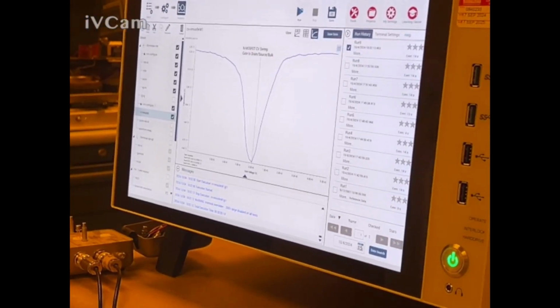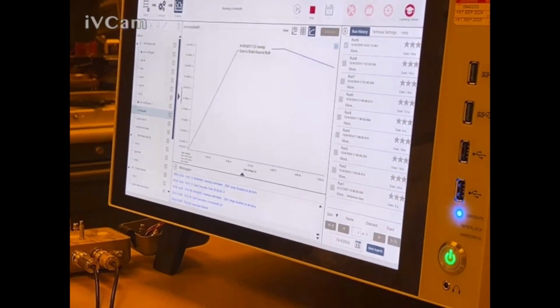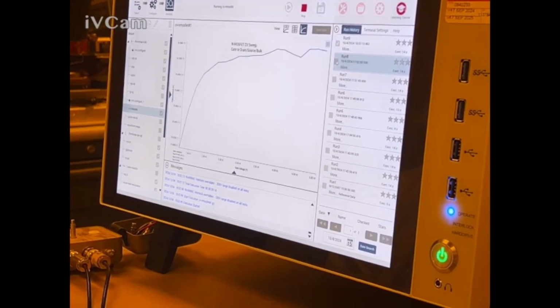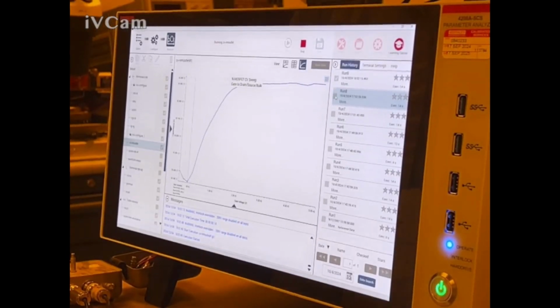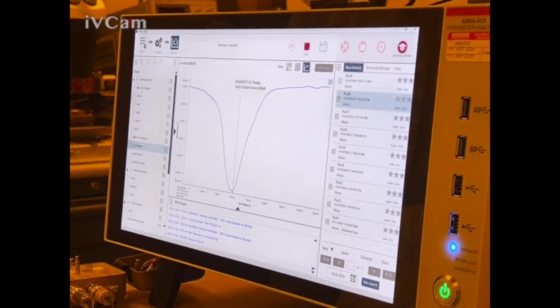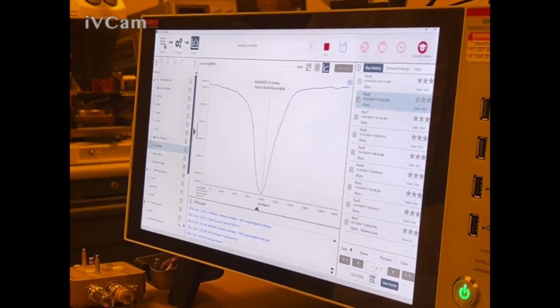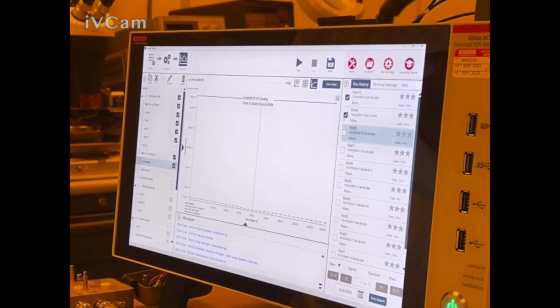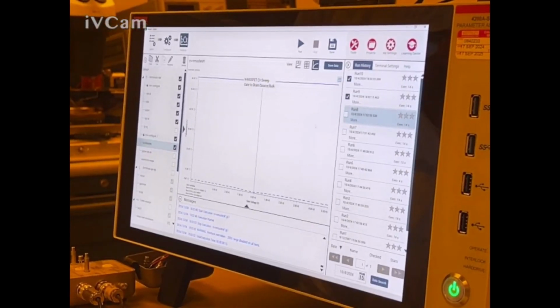What is the open compensation? Eliminate the open compensation. No, I added the open compensation. I added it. Oh, I first ran it without the compensation. So that means you should have a higher value. But now watch this. If I compare, oh, now why did it not work?